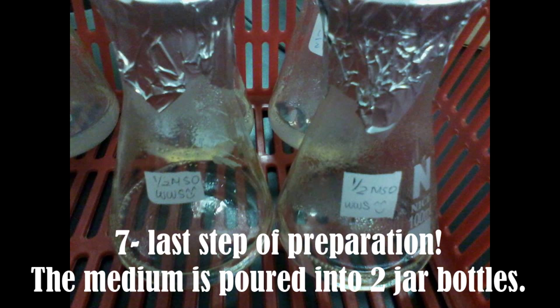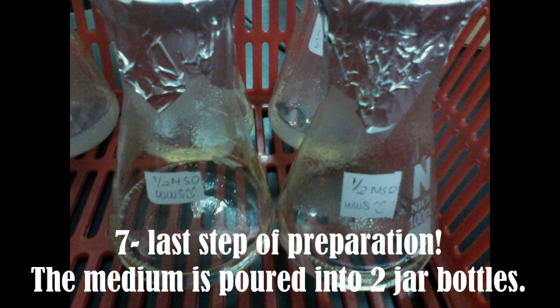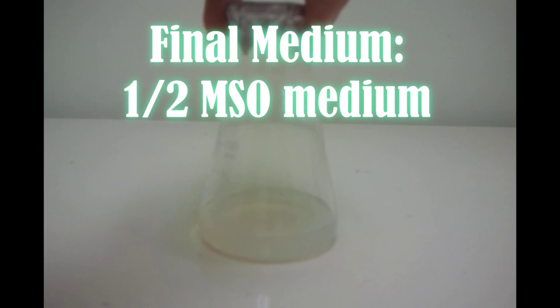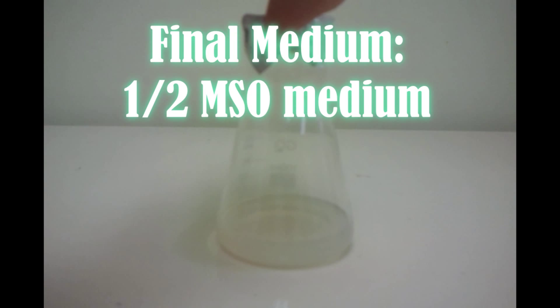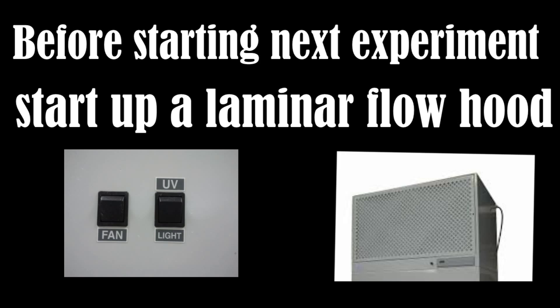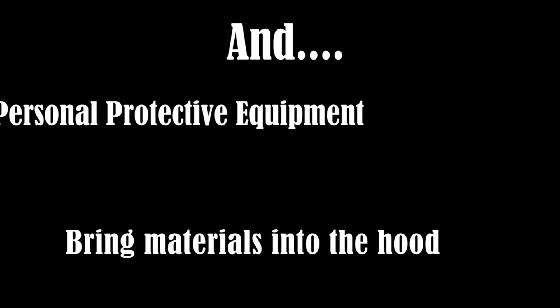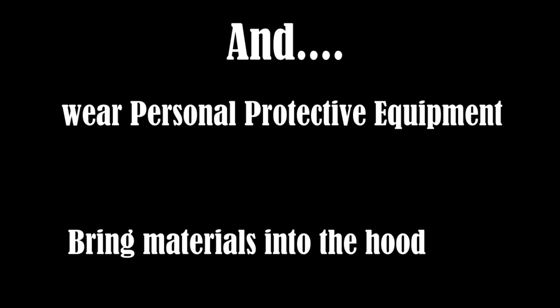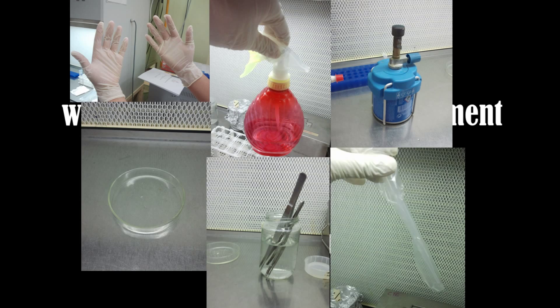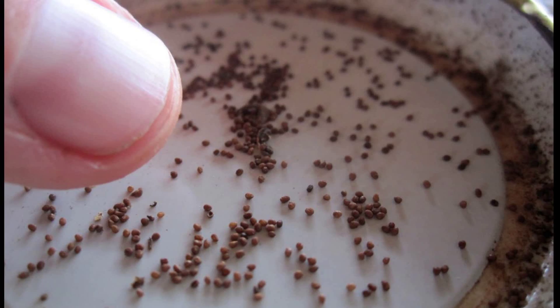Finally, pour the medium into two bottles. Remember the sterility of the bottle is really crucial at all times during media preparation. Before starting the experiment, the laminar flow is set up. Personal safety is highly recommended for this experiment — wear the personal protective equipment before moving the materials into the hood.